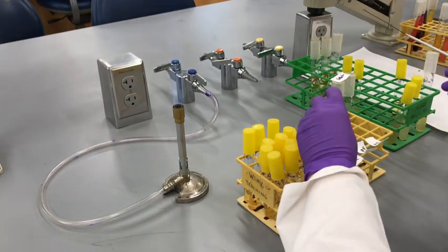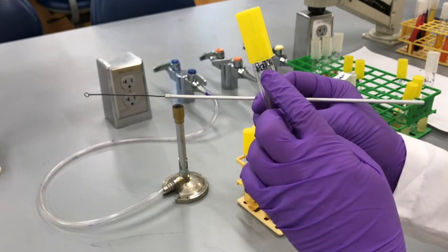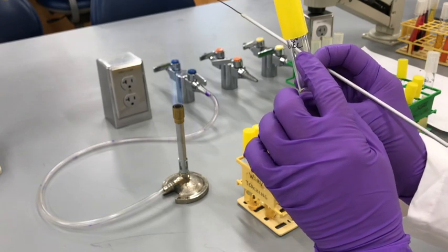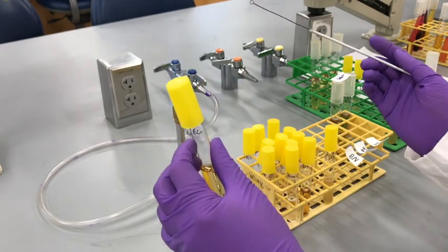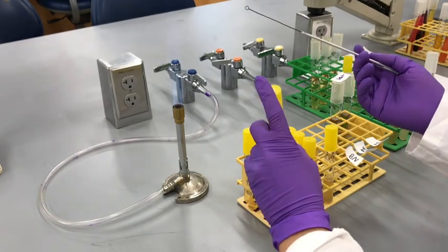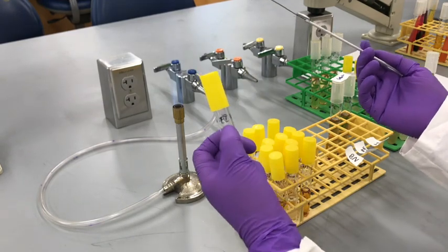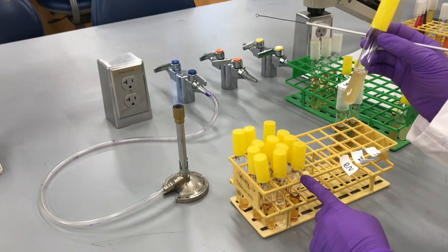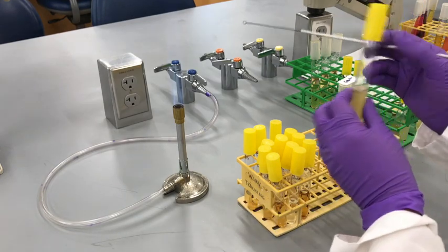Now I have already labeled my tubes for evaluation of media, and I'm going to show you one. This is nutrient broth, today's date 8/13, GG my initials, and the organism I'm going to inoculate with, which is E. coli. Again, you can write 24 or 48 hours, but if you have the date on, it would be fine. I've already flamed and cooled down my inoculation loop, and the very first bacteria I'm going to inoculate with is E. coli. I'll use that for nutrient broth, glucose salts, and brain heart infusion. I'm going to show you one, and then it is basically the same process.